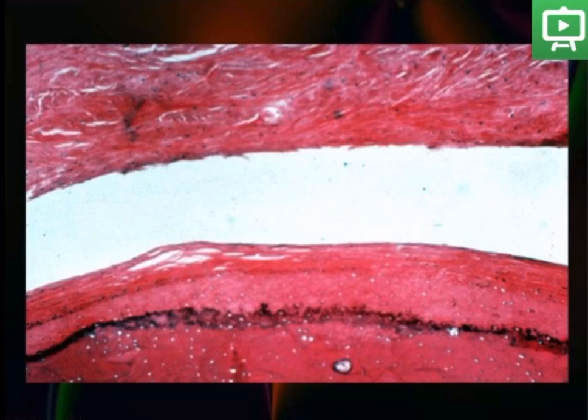You see there is a transition zone in between. So irregular fibers are deeper, which come in contact with the disc. Here you see the proliferative zone of cells, darker, and the cartilage, the calcified cartilage layer.